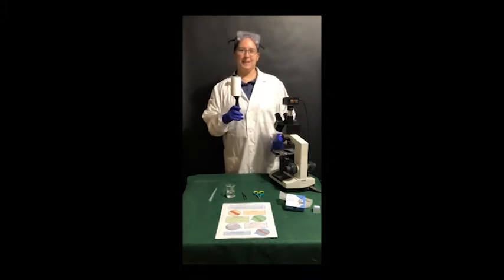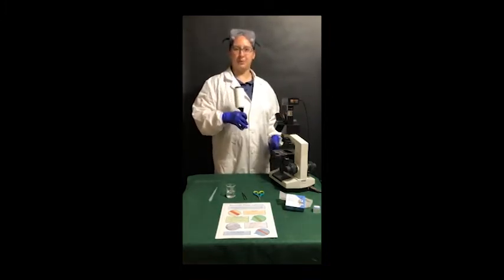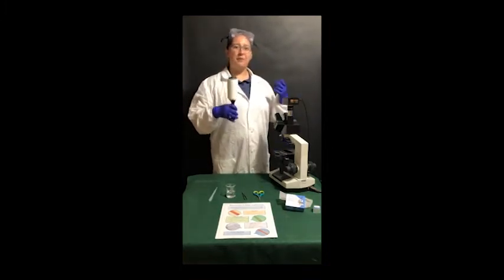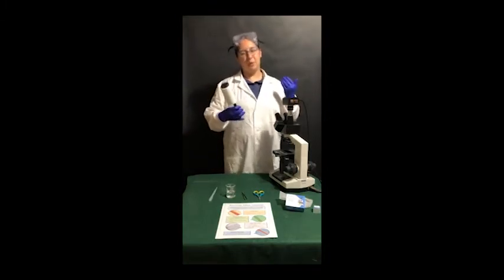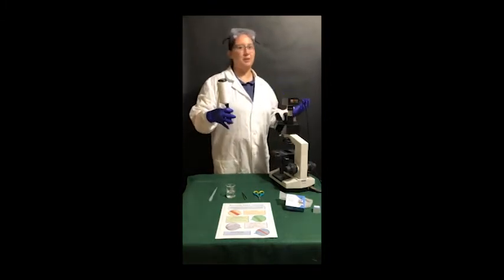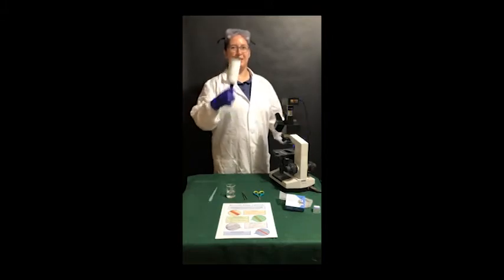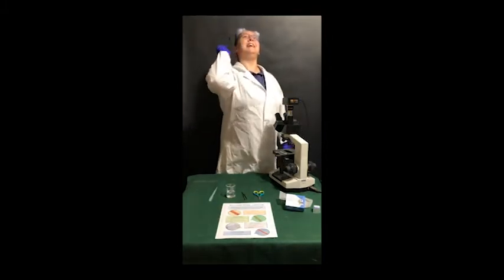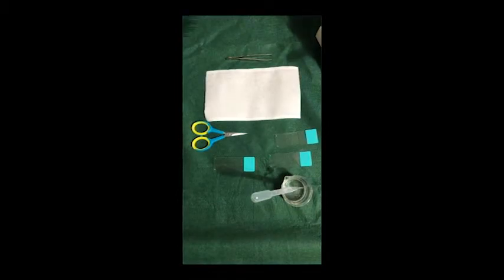Afterwards, if you wouldn't mind stepping forward so that you can watch me make some microscope slides, that would be awesome. All right, here we go.